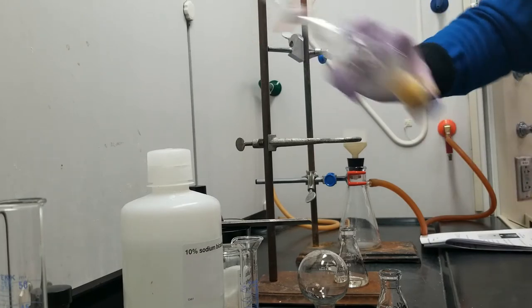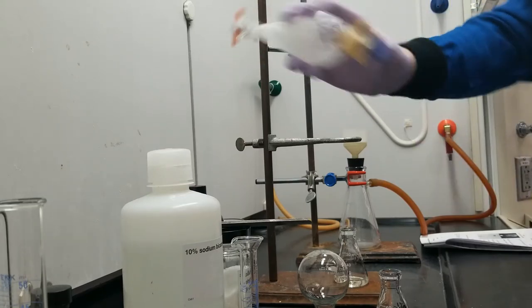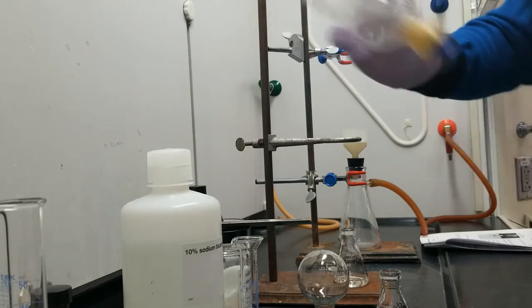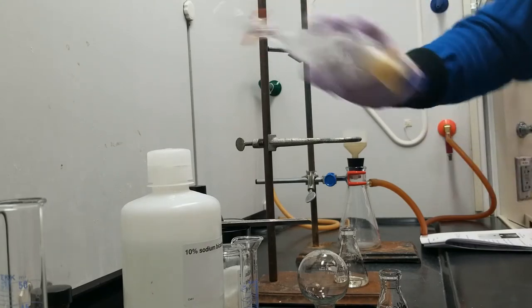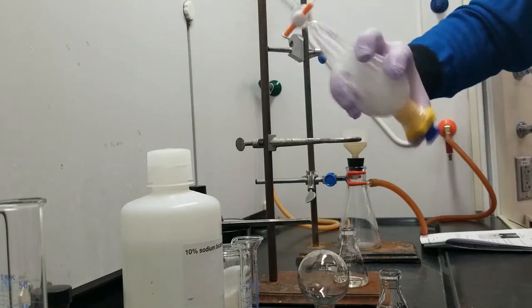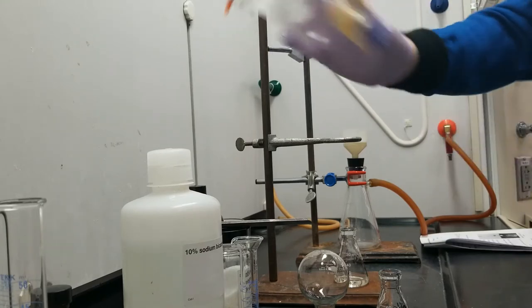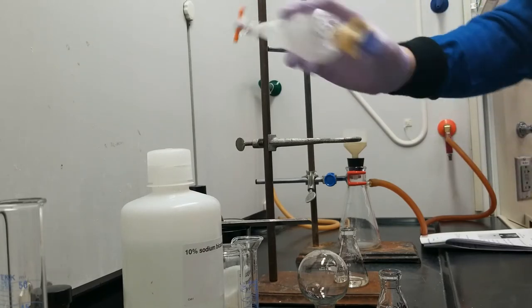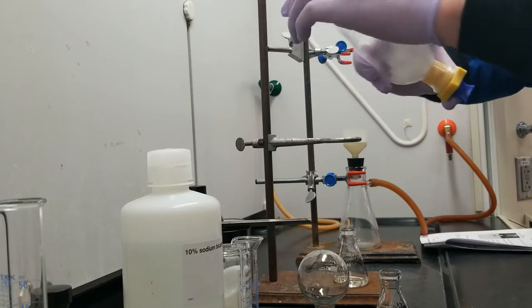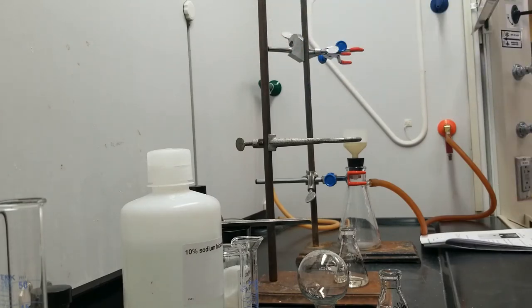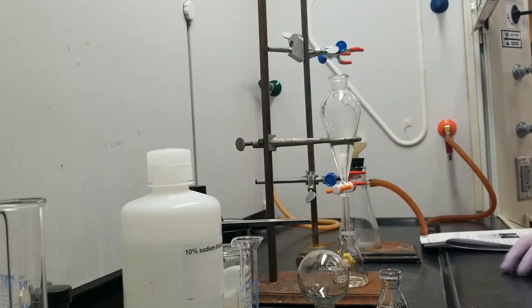And to be super thorough, I would typically continue doing this for several minutes until the gas stopped forming completely in the container, and then for a minute past that. I'm already starting to lose almost all of my gas right now. But clearly, this second extraction was necessary because we had some gas formation occur, so there was still some 3-chlorobenzoic acid that we had to deprotonate. All right, that's no more gas at that point.